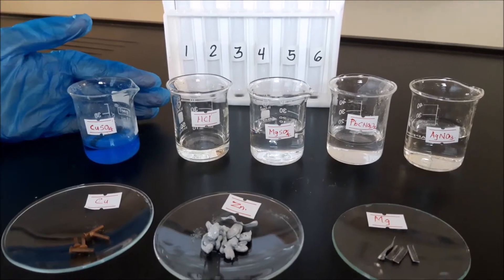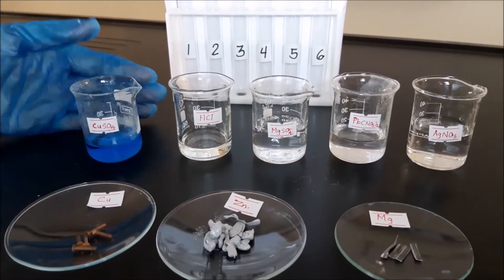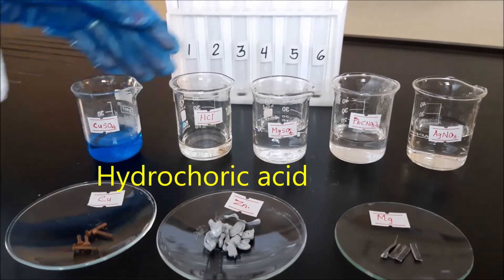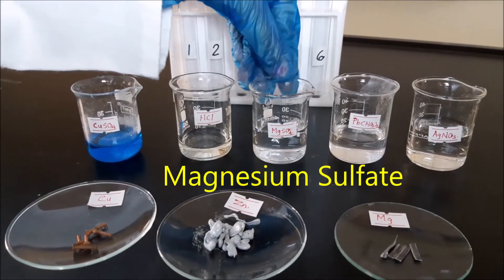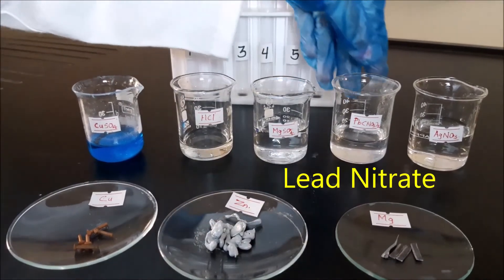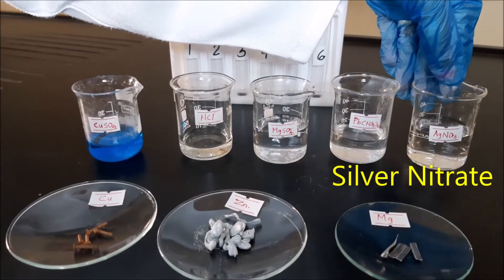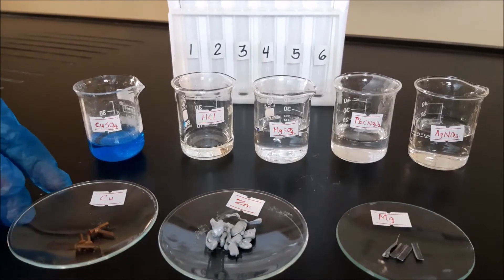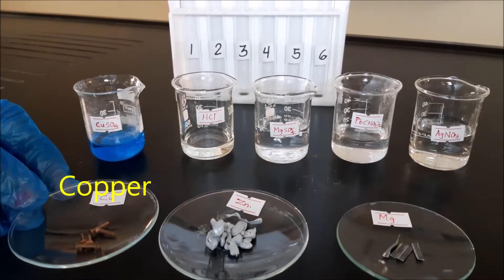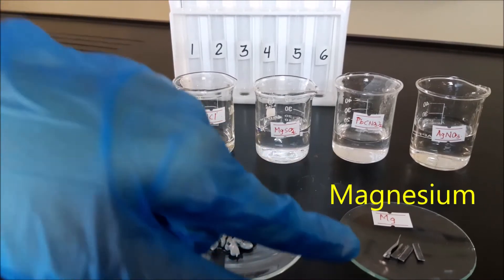We are going to use copper sulfate, hydrochloric acid, magnesium sulfate, lead nitrate, silver nitrate, and for our metals, we have copper, we have zinc, and magnesium.